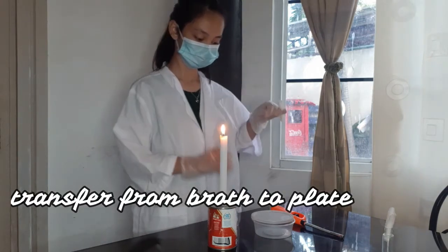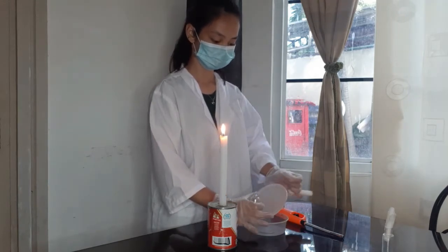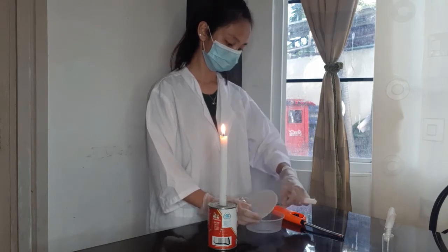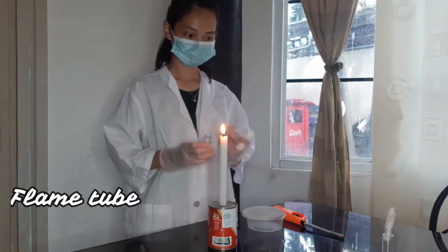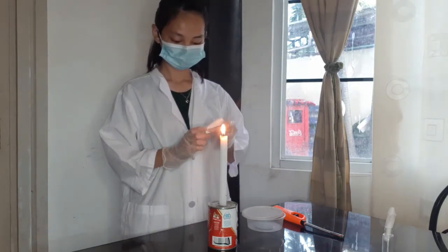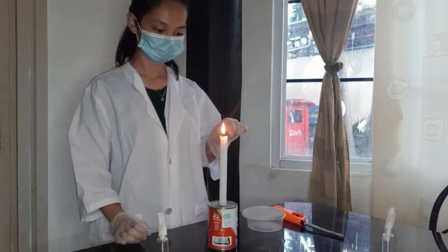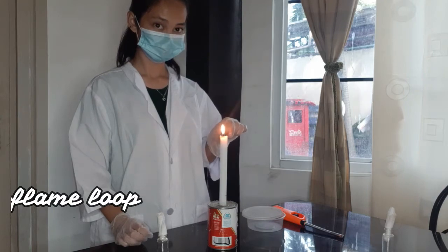Transfer from broth to plate. Flame the tube once more and cover it with the cotton plug. And lastly, flame your loop again for sterilization.